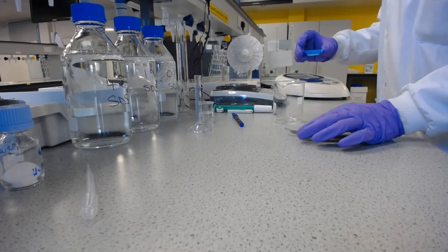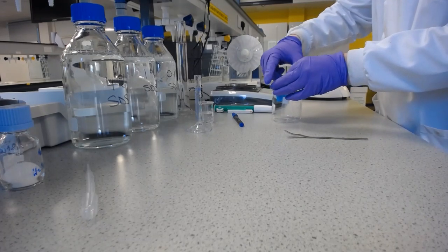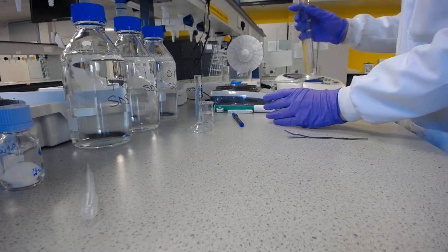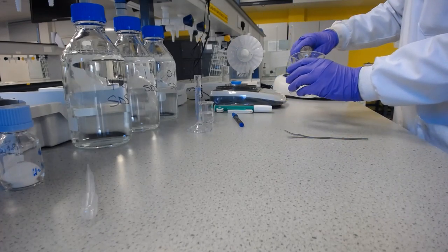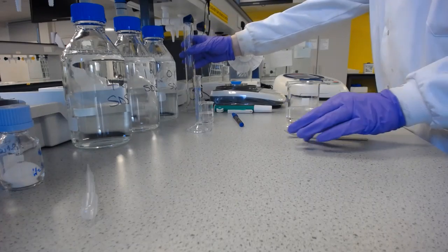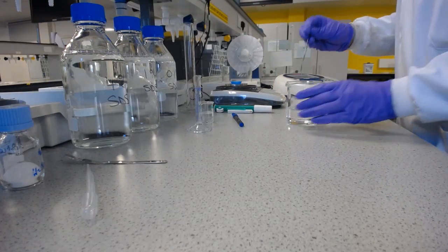And so I'm going to do that in a beaker, make sure I get all of the aspirin out, because it is small amounts we're talking about here. So any slight error is a big percentage error, so we need to be careful. And then I've previously measured out 100 millilitres of deionised water, which I'm just going to put in here. And then I'm not going to use that same spatula to mix this, because it might still have aspirin on and it'll affect the results. I'm going to take a clean spatula and mix this round.